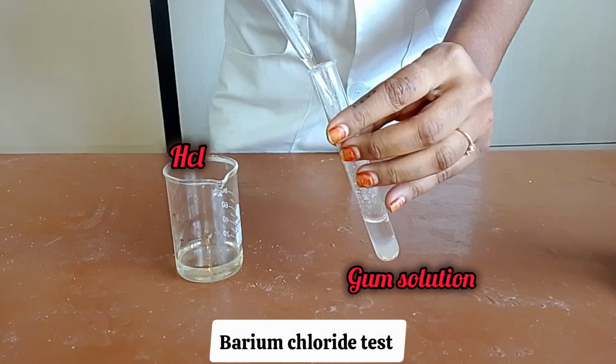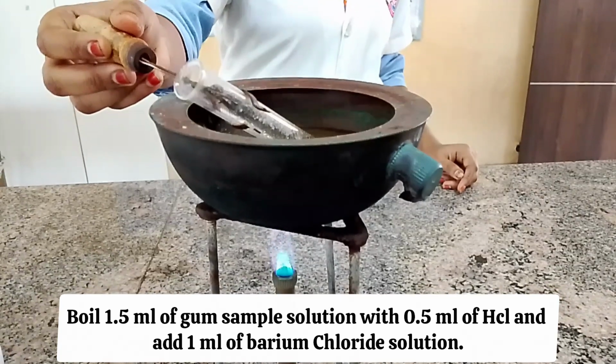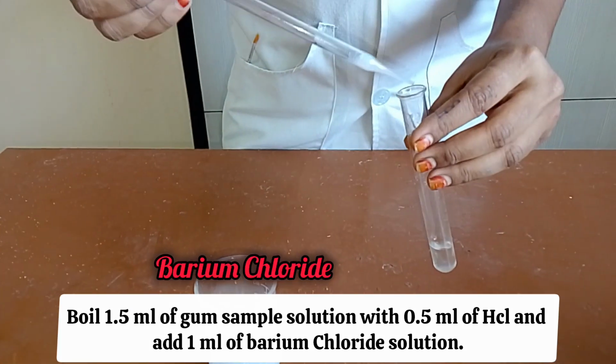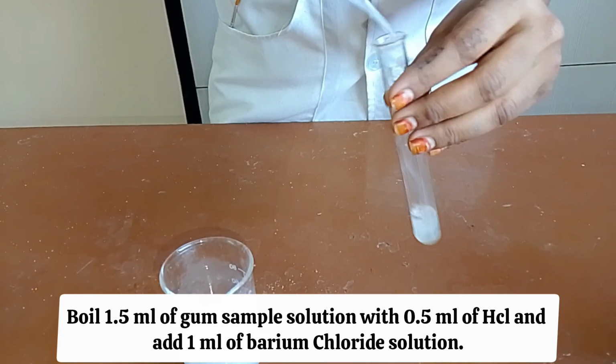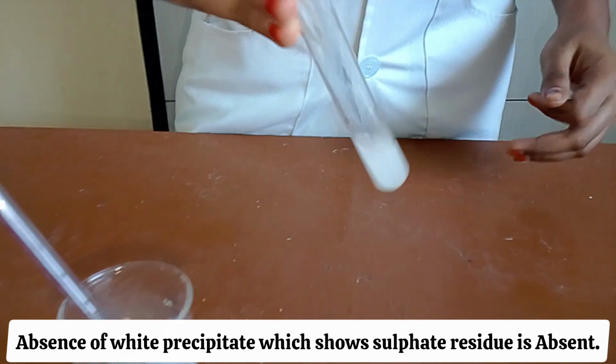Barium chloride test. Boil 1.5 milliliters of gum sample solution with 0.5 milliliters of HCl and add 1 milliliter of barium chloride solution. Absence of white precipitate, which shows sulfate residue is absent.